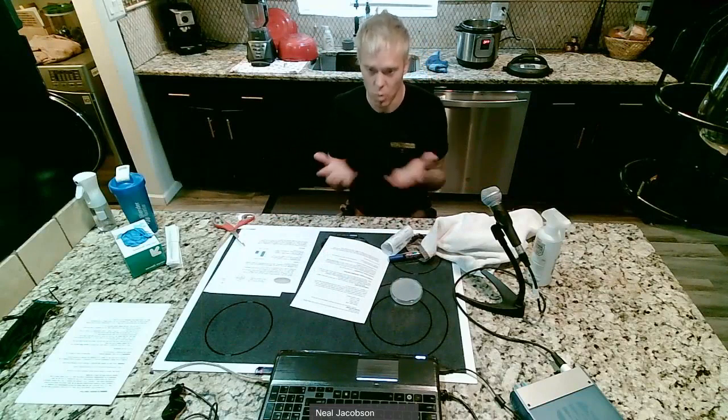Okay, next, wash your hands. Now, usually you're saying row, row, row your boat gently down the stream. Do that. So go wash your hands, sing row, row, row your boat the whole time, just like you would normally do. And then think about it. Are you going to dry your hands with a used towel, or are you going to dry it with maybe a clean paper towel? So remember, you could also transfer bacteria from the towel to your hands. So I'm going to actually use a paper towel for my kitchen when I go to dry my hands. So I'm going to pause the video. I'm going to wash my hands, and I'll come right back and start it again.